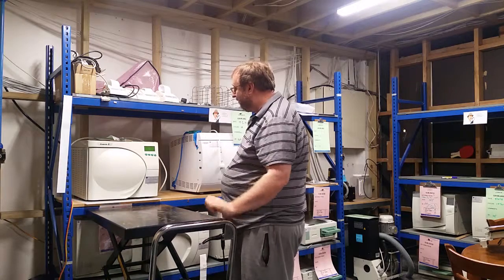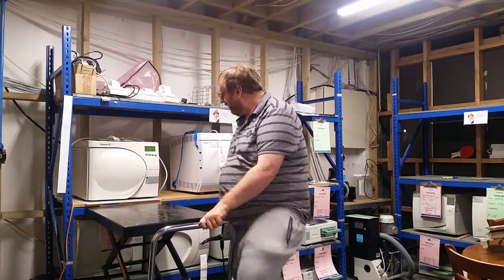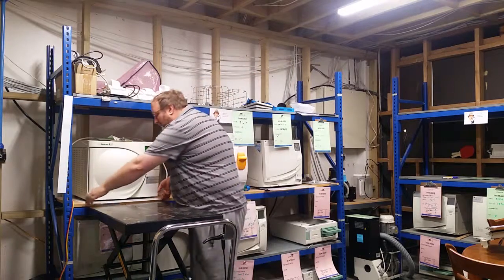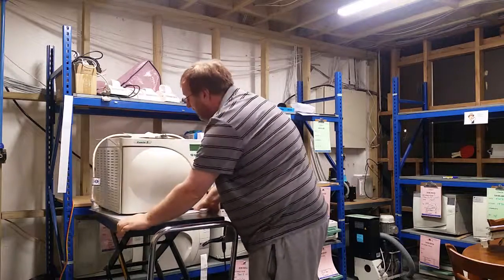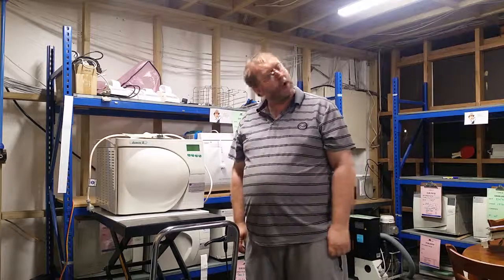And now when I want to grab one off the shelf, I just come along and rack the trolley up, make sure it's just a whisker below the height of the thing, and the whole thing moves nicely. No stress, no hassle — that's how we do it in Christchurch. Booyah!